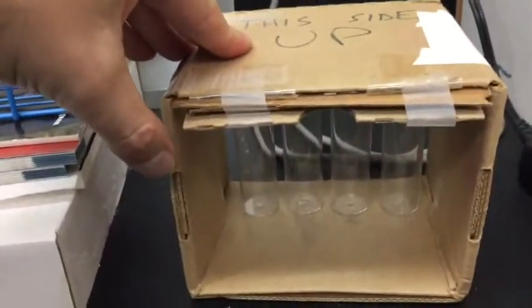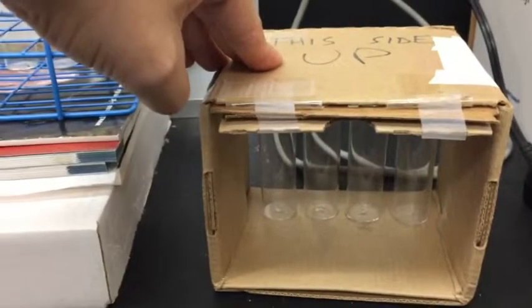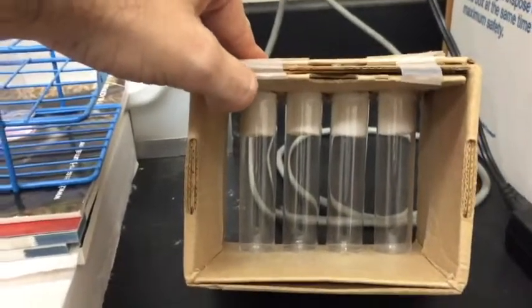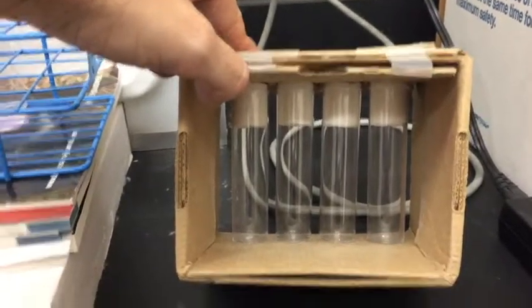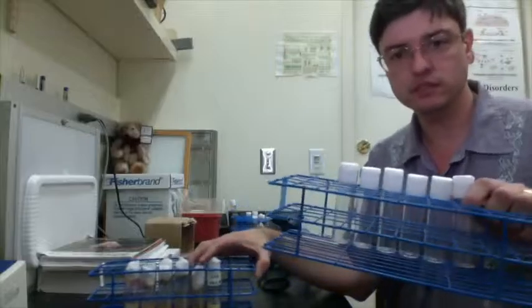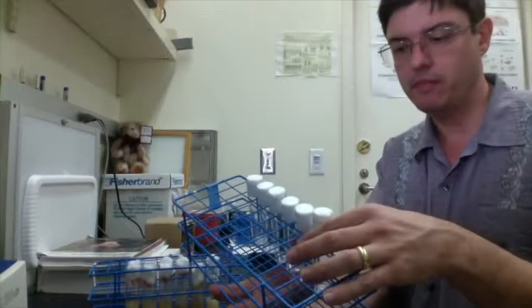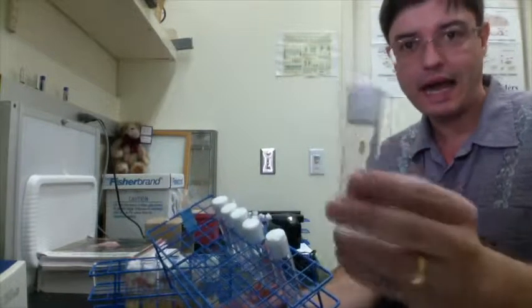This is another rack that was constructed out of a Bloomington Drosophila box, and you can put the flies in there and measure them as well. Alright, so we're going to transfer these 6 vials of flies into these empty vials. These are plain empty plastic vials, but I do want to make a note about the cap.